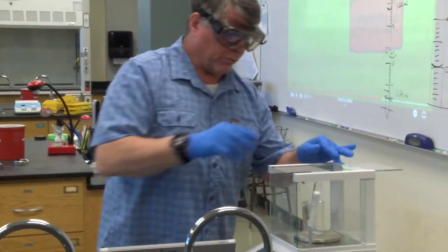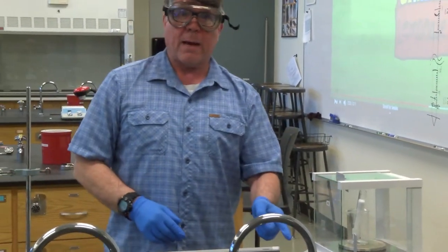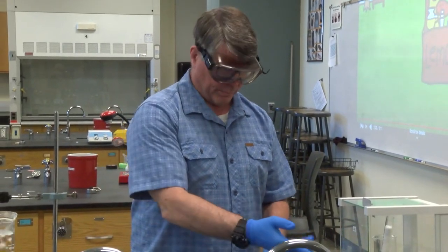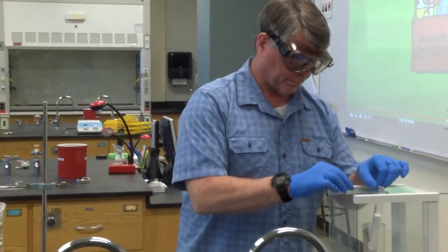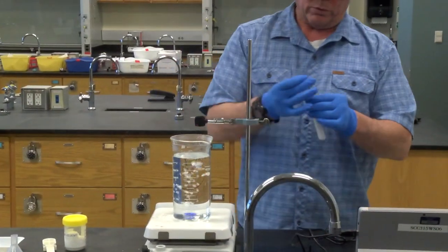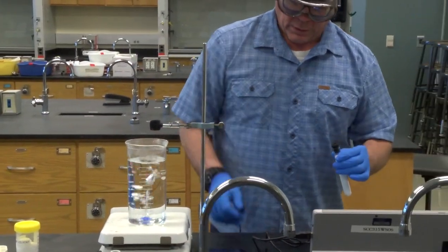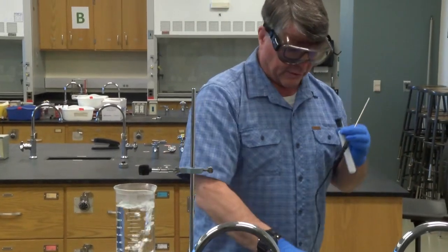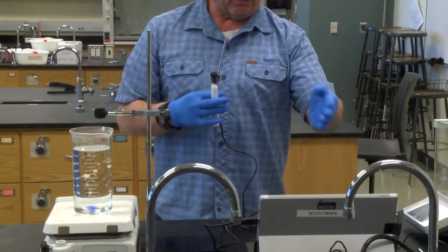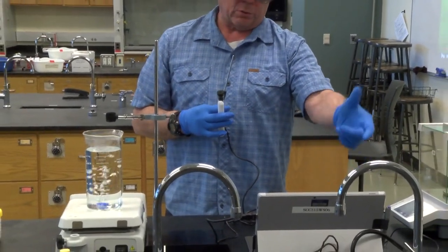Put it in there. Close the doors. You're going to need that mass in your data table. That's a very important number. That's the mass of your solid in grams. Take it out. Put the one-hole stopper in. This is a temperature probe which is connected to your LabQuest, which is connected to your Surface Pro. And you'll have Logger Pro running on your Surface Pro.